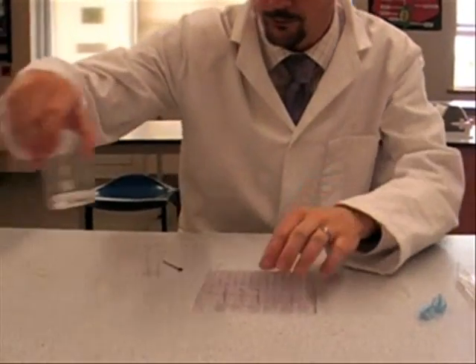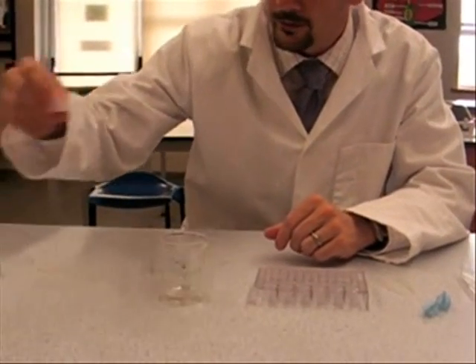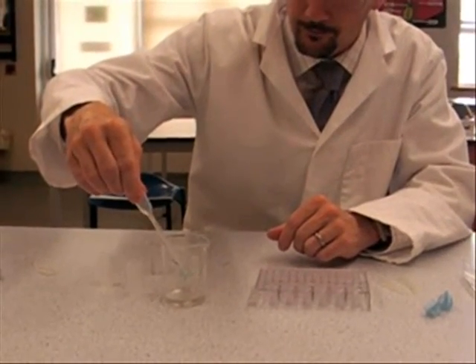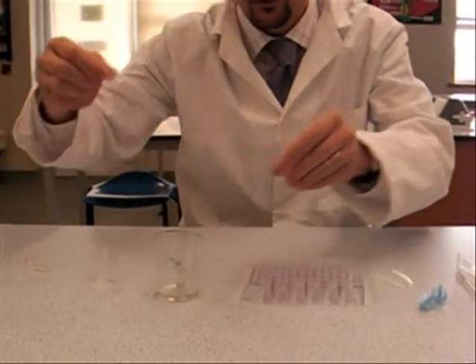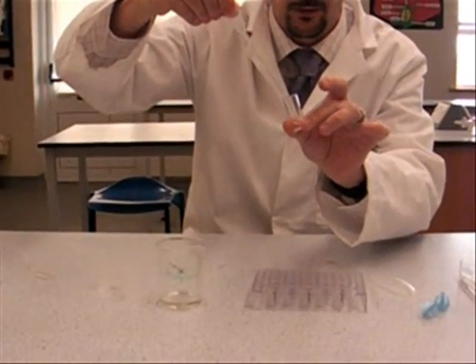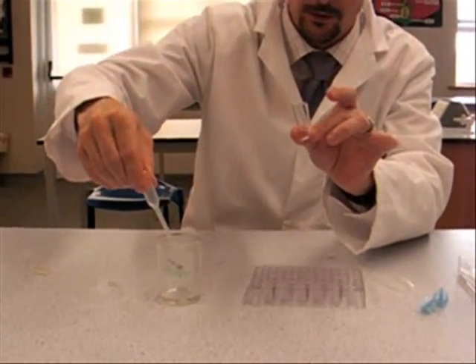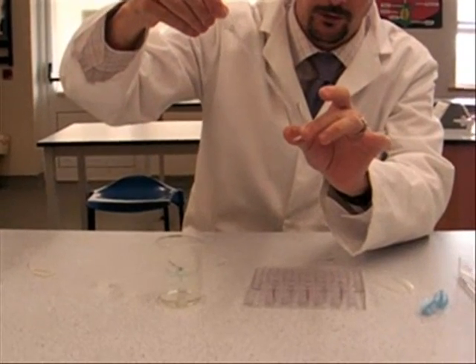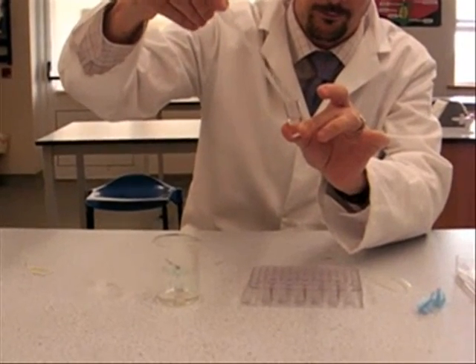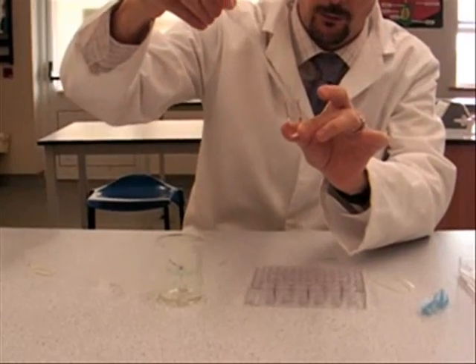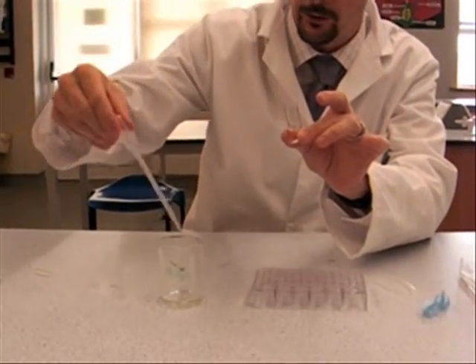So, we've got some methylated spirits and a pipette and you just need a couple of squirts, should be fine. In fact, no more than about half full really, you're not going to need anywhere near that much.